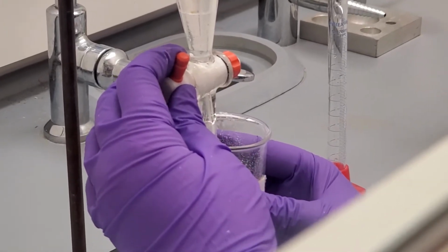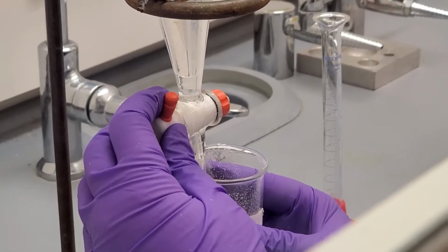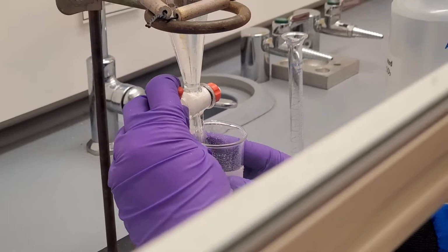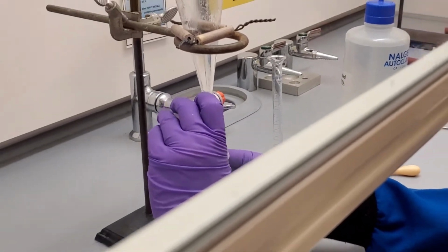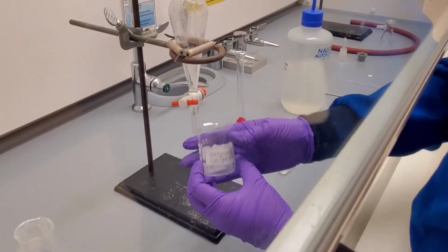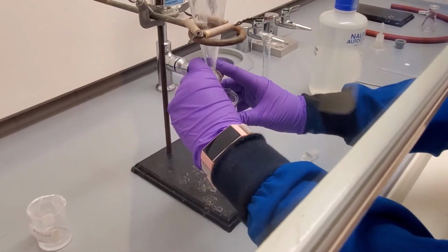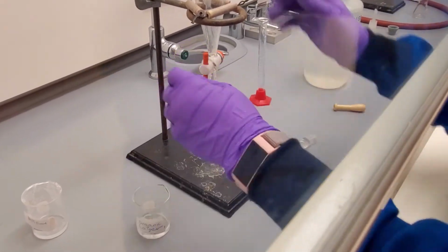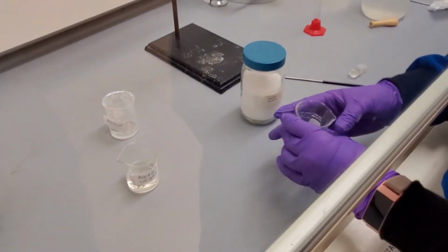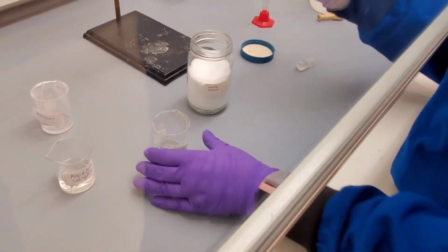Drain this aqueous layer to a waste beaker. This time, you want to fully drain the aqueous layer so that the ethereal layer starts to enter the spout. This will ensure that no extra water will remain. Move the waste beaker aside, grab a beaker labeled organic layer, and hold it beneath the spout. Fully drain the ethereal layer into the organic layer beaker. Because this is the only remaining layer, you do not have to worry about how fast the solvent is flowing. Now we have our 2 layers in their own beakers.